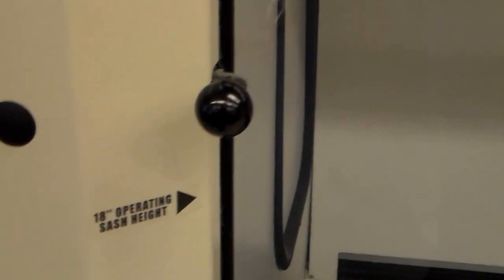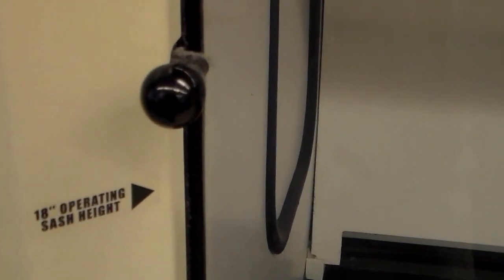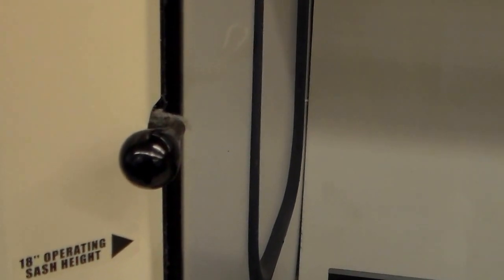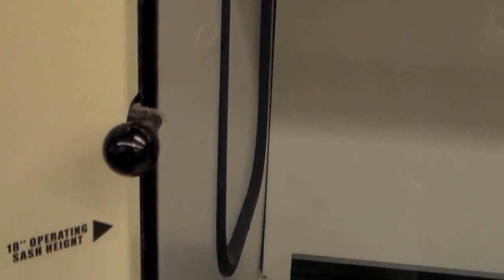When you're using them, make sure that you don't take the glass door above the recommended sash operating height. If you do, it's not pulling enough air through it to keep the fumes from filling the room. But you can take it higher whenever you need to manipulate glassware and not have it knocked out of your hand. This acts as an extra barrier protection as well, along with your lab goggles, but we don't take the lab goggles off even when we're working in the hood because it's supposed to be extra protection.